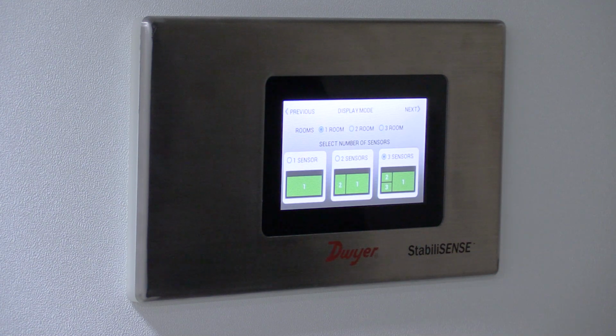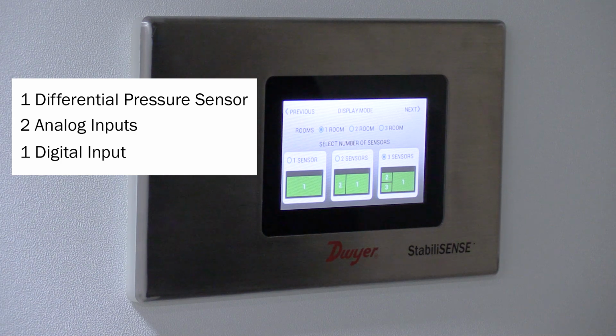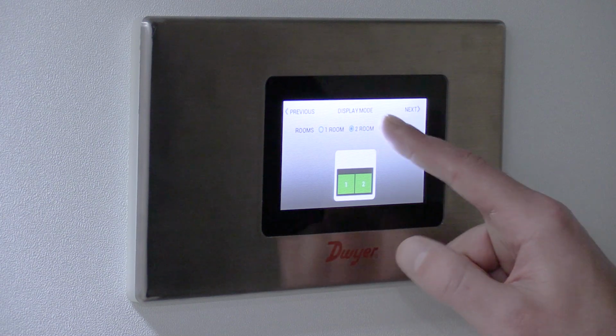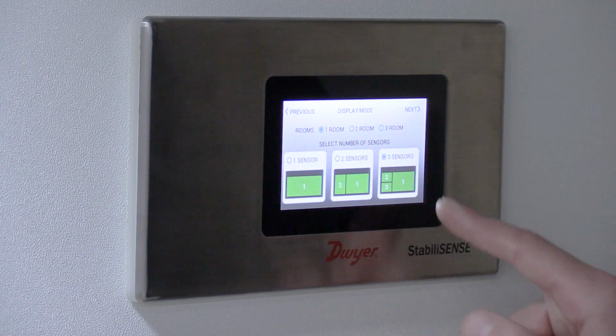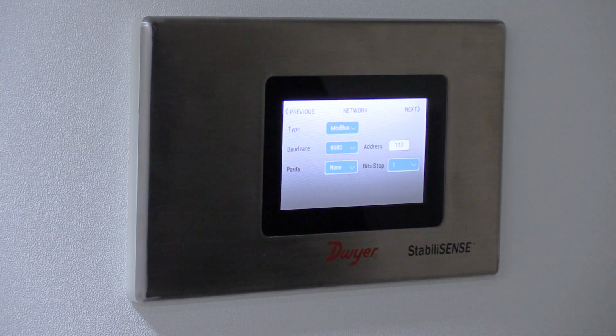If you select a local configuration, the next selection is the number of rooms and the number of sensors you wish to program into the RSMC. Every RSMC has one built-in differential pressure sensor, two analog inputs represented as user input 1 and user input 2, and one digital input for a door status switch. One room, two rooms, or three rooms can be selected, and up to 3 parameters can be displayed simultaneously on the RSMC. The next selection screen is network.